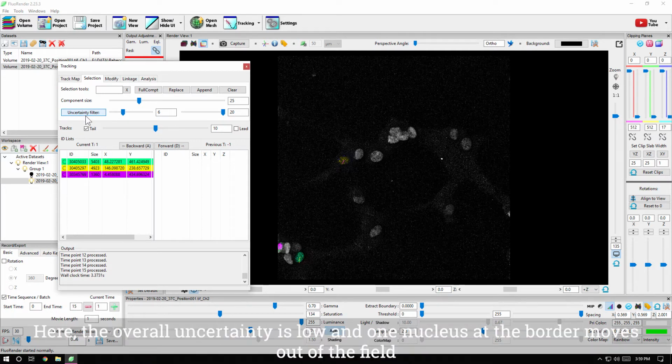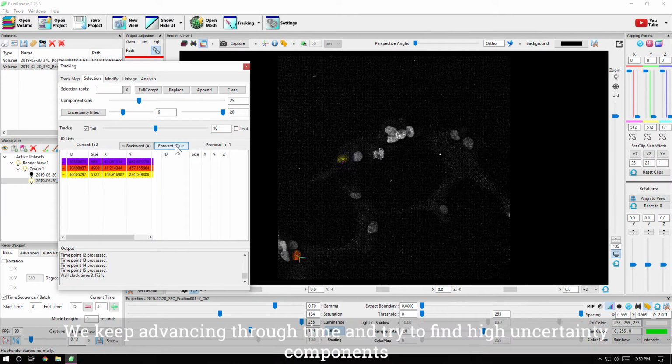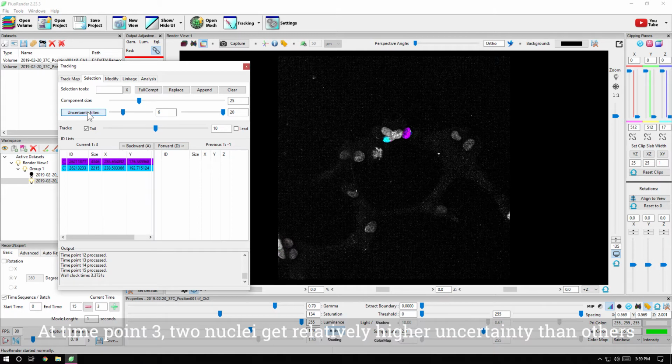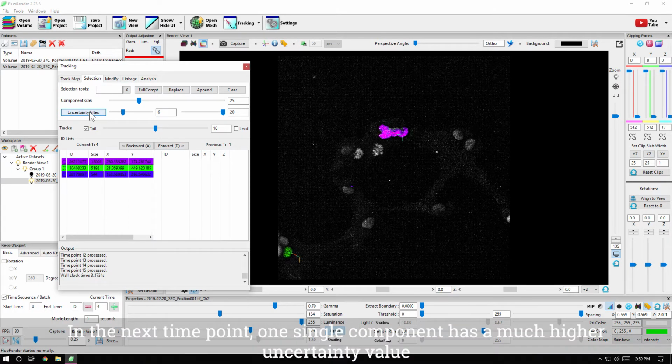Here, the overall uncertainty is low and one nucleus at the border moves out of the field. We keep advancing through time and try to find high uncertainty components. At time point 3, 2 nuclei get relatively higher uncertainty than others. In the next time point, one single component has a much higher uncertainty value.